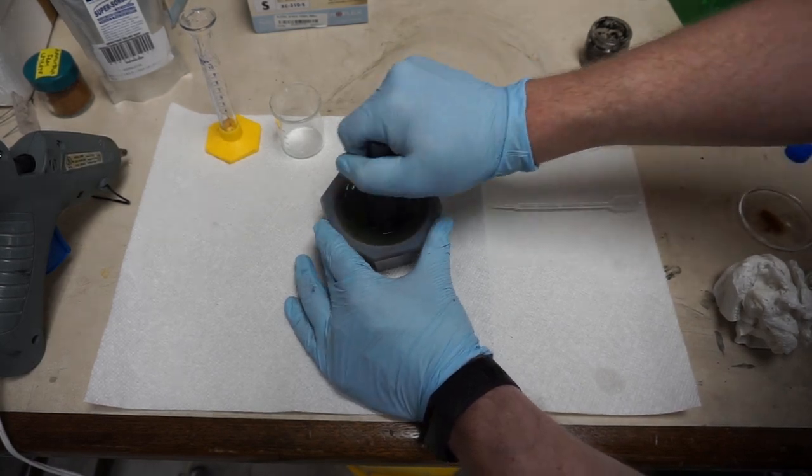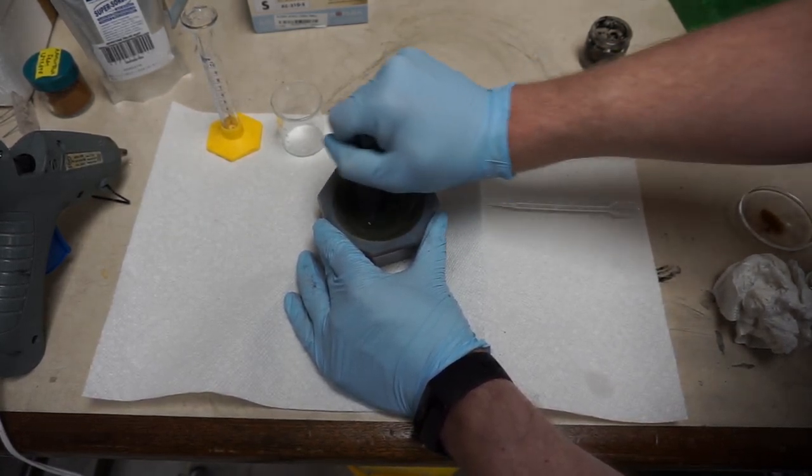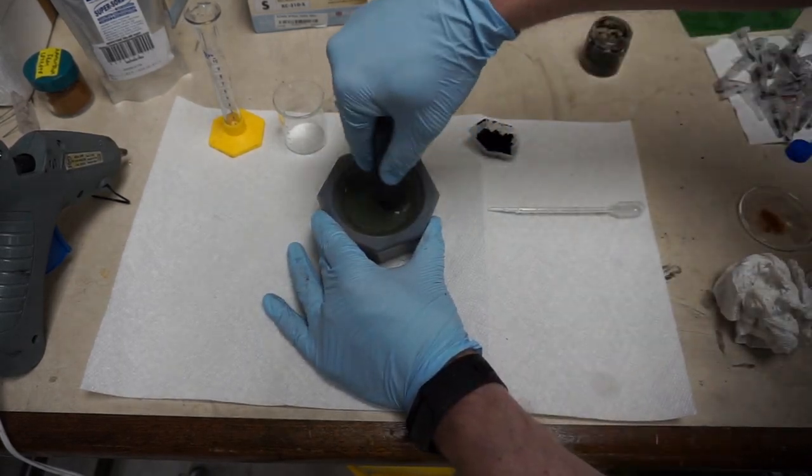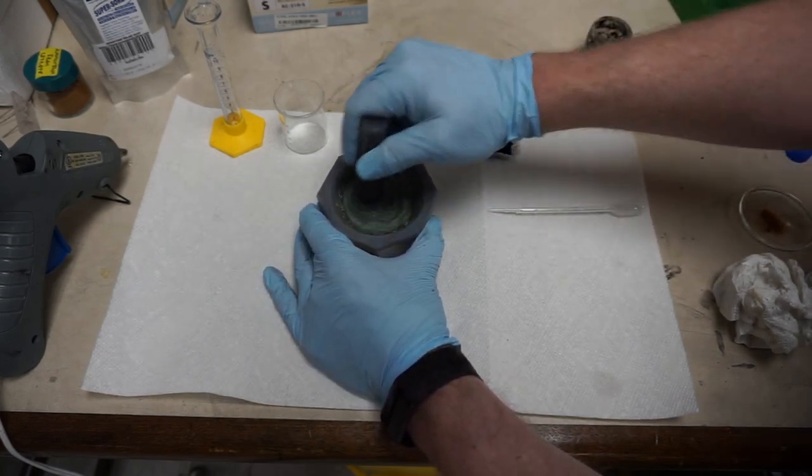I'm shooting for a final concentration about 2 molar, but that's really beyond the solubility limit, so we're going to just do our best. If you heat the liquid, you can maybe get it to go a little better into solution, but we're going to add sodium hydroxide next, and that crashes it anyway.